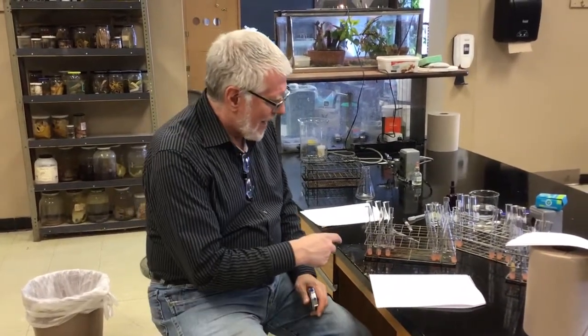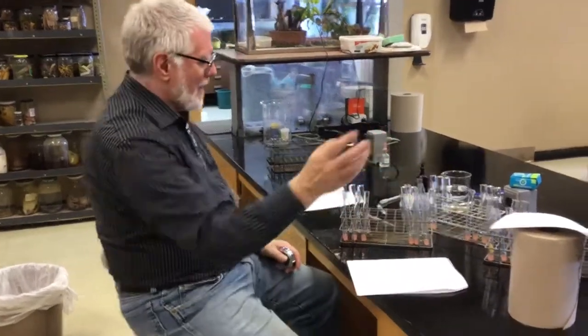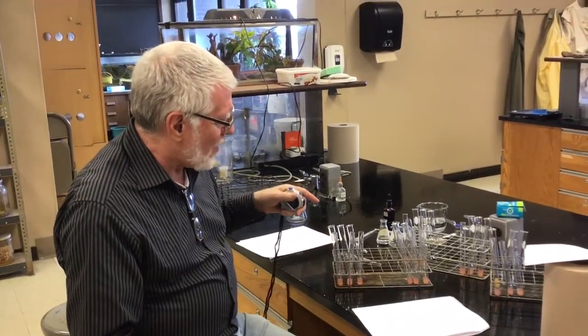So we are going to hopefully get Michaelis-Menten kinetics to work. This is our enzyme, and there's 1 milliliter of this in every one of these test tubes. Actually, for reasons that I'm not gonna explain, there's 2 milliliters in each one of these test tubes, but it still works out okay. And what we're gonna do is vary the substrate.